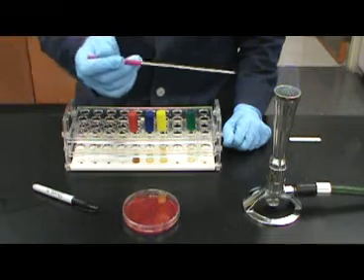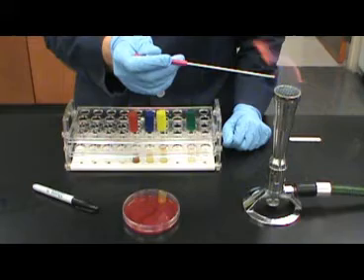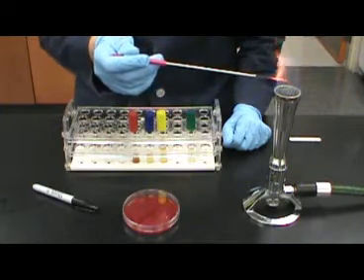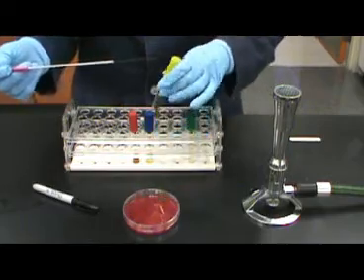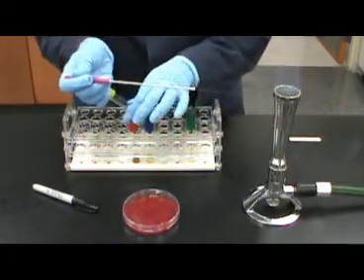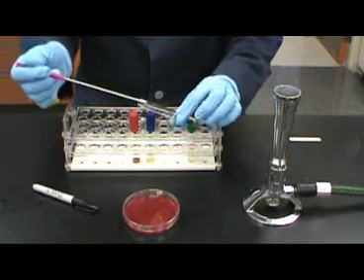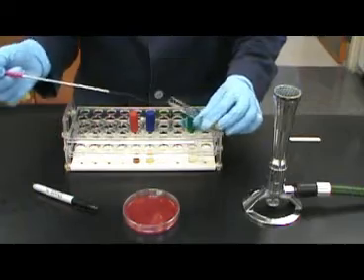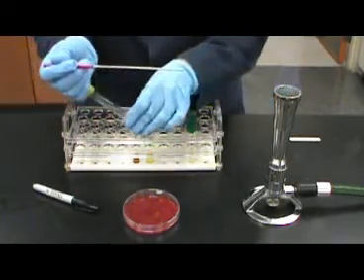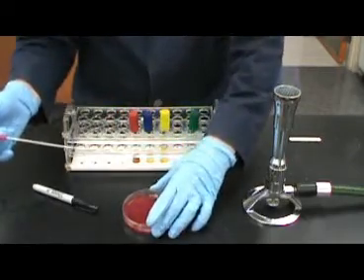There are 2 different ways to inoculate the blood agar plate. Both will require aseptic technique. For the first technique, it is a simple plate inoculation. Make sure when you are inoculating the plates that you know which quadrant should contain which bacteria, and that they are inoculated in the correct spot. Here, aseptic technique is being used to do a simple straight line inoculation on the plate.